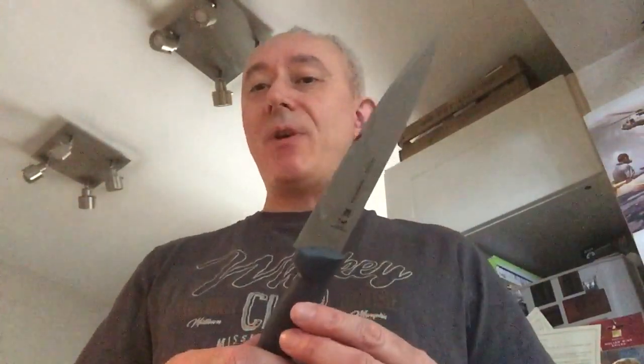Hello, welcome to the latest video looking at clean room issues in around five minutes. Why is Tim holding a knife? Has he gone crazy? Well, not quite. But inspired by Richard, I wanted to look at clean room contamination from a different perspective, and I'd like to do that illustrated with the humble onion.